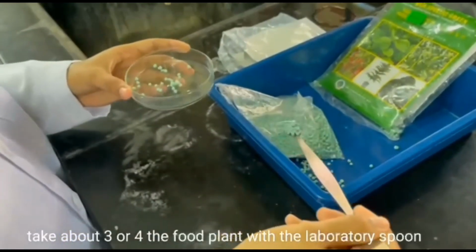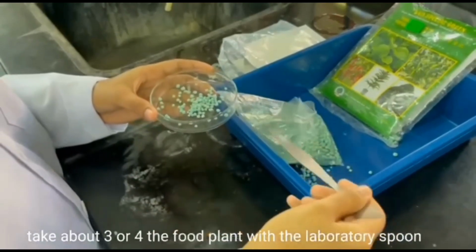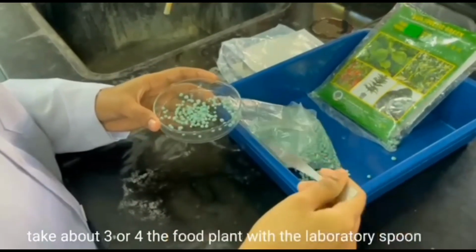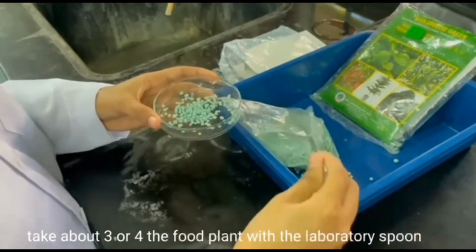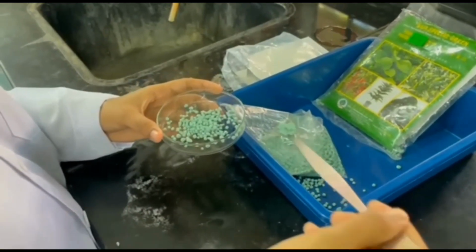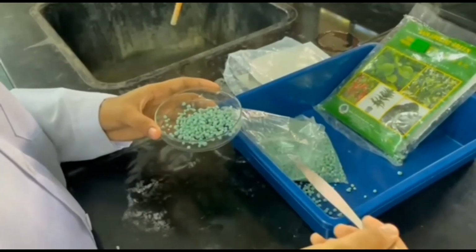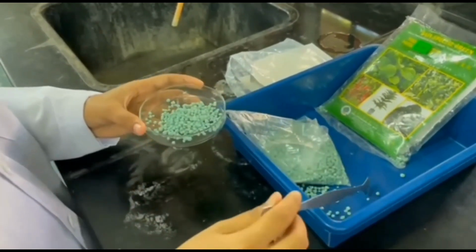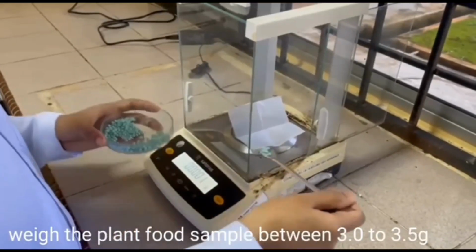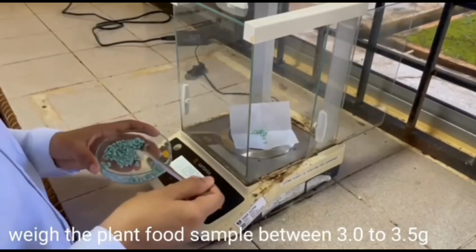Take about 3 or 4 of the plant food with the laboratory spoon. Weigh the plant food sample between 3.0 to 3.5 grams.